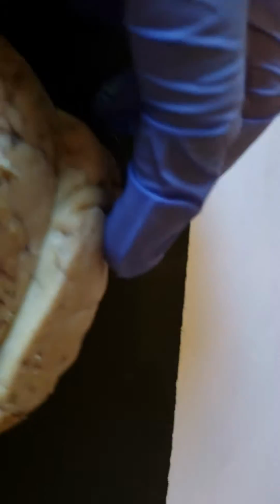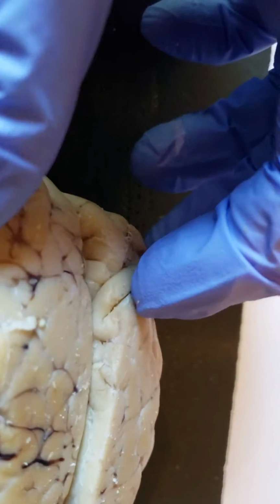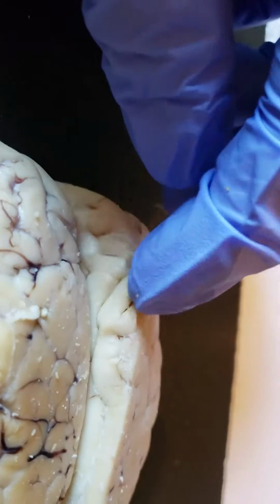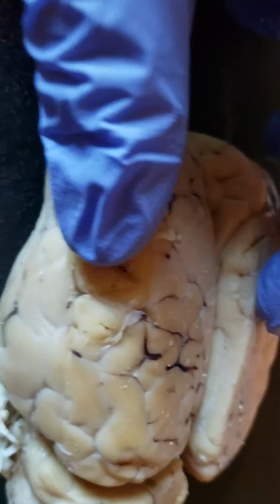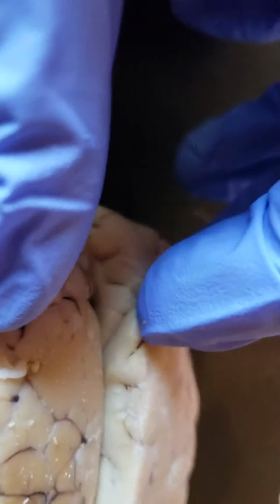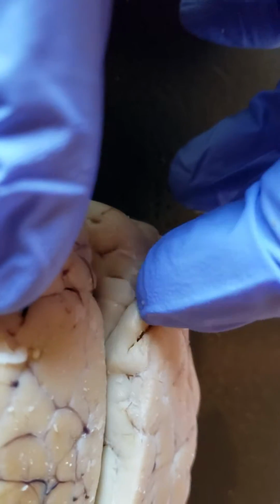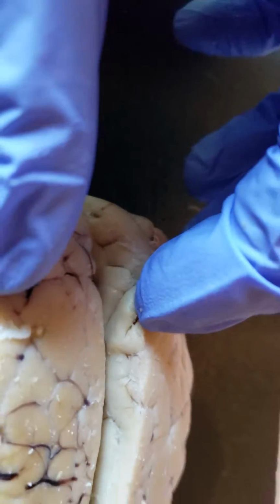Okay, moving on, you have gyri and sulci. It's sulcus, so it's probably sulci. A gyrus is going to be one of these little ridges which you have all over the brain. You can see them wrapped in tight here with the meninges. And then the sulci are going to be these little valleys that run in between two different gyri.